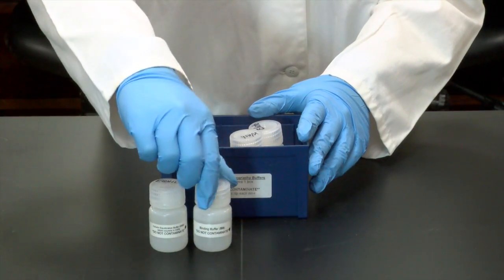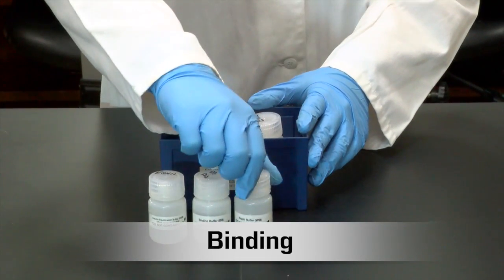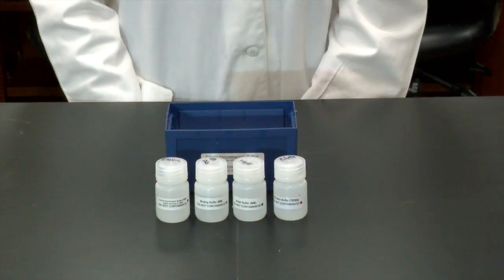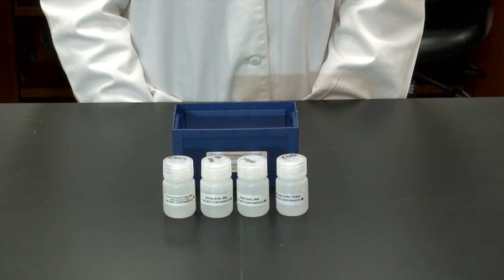The chromatography kit comes with four buffers: equilibration, binding, wash, and elution buffers. Do not contaminate the bottles or mix up the order of their use.